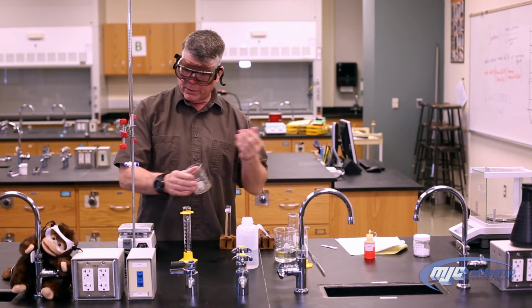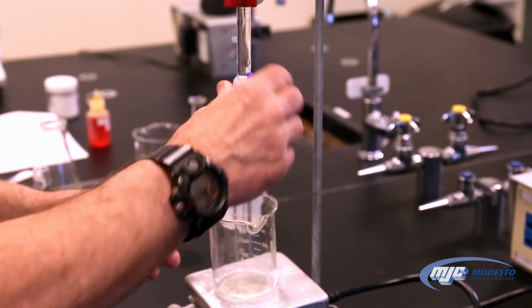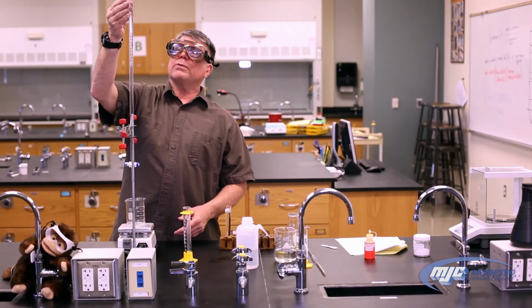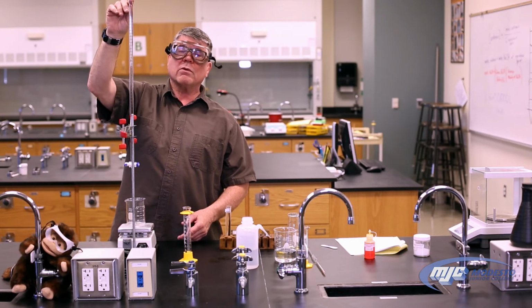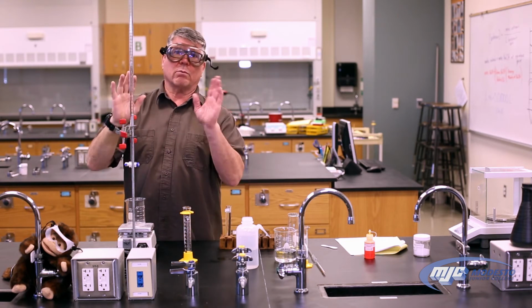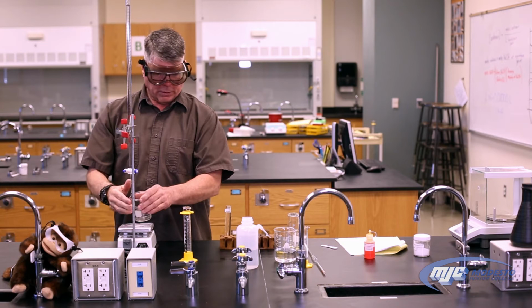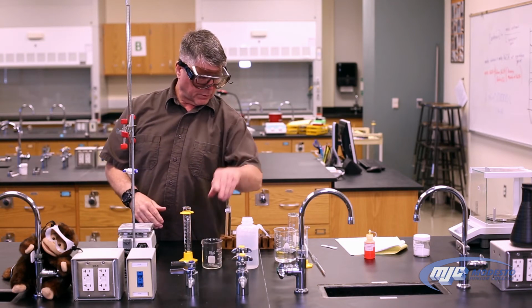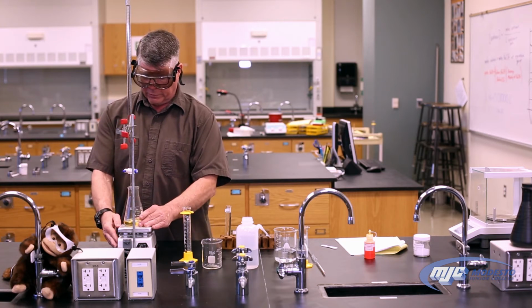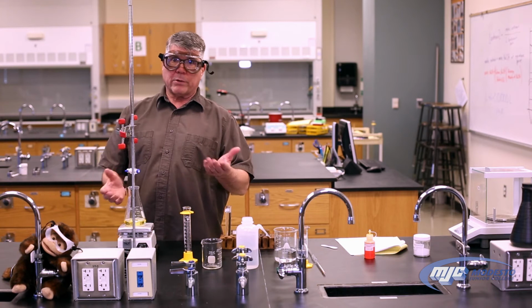I'm going to take a waste beaker, put it underneath the buret, and open it up. And I don't know if you saw those air bubbles come out, but they did. And now the level of the stock solution in the buret is beneath the 0. It doesn't matter where, and we're good to go. That's going to be our initial volume. Set that aside. Put the flask back on the stir. Now we're ready to start our titration.